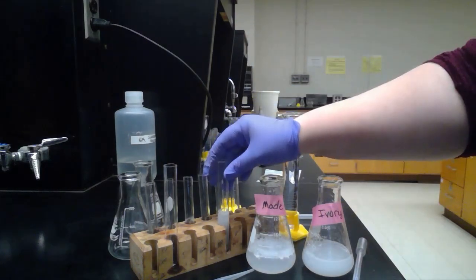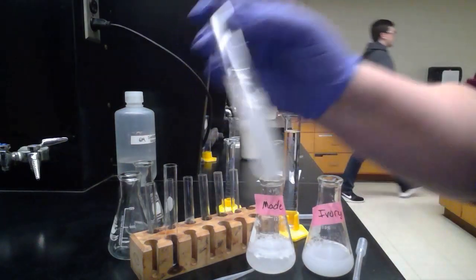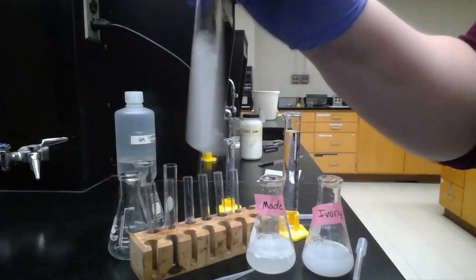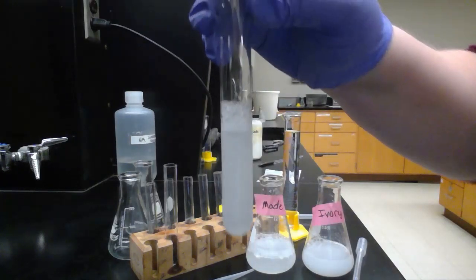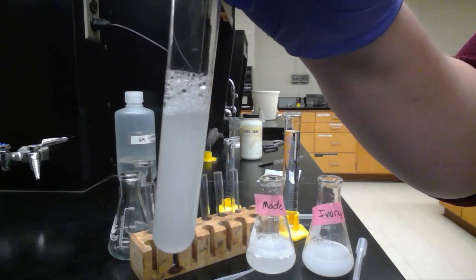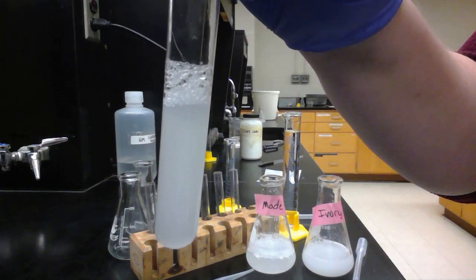That's three, and what I'm going to do is shake this vigorously while holding my finger over the top and seeing what kind of foam formation that we get. That's what we have with our control soap.